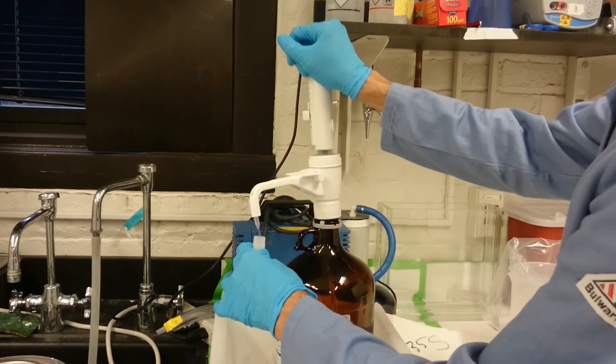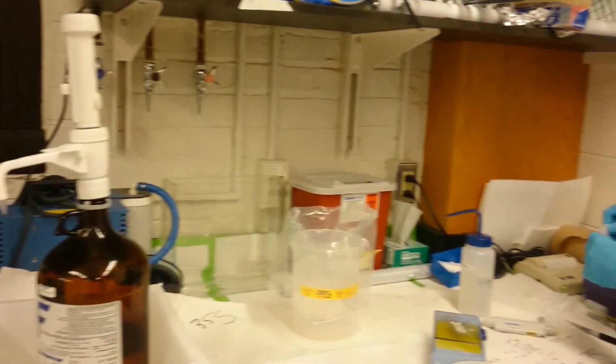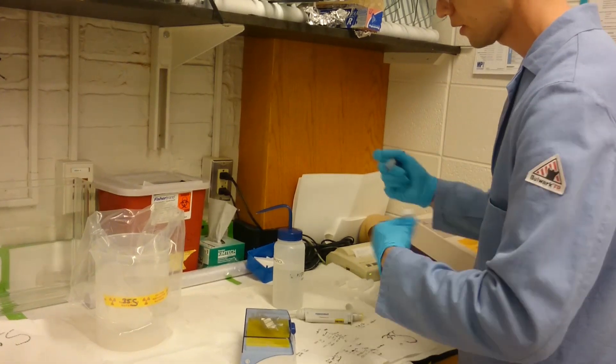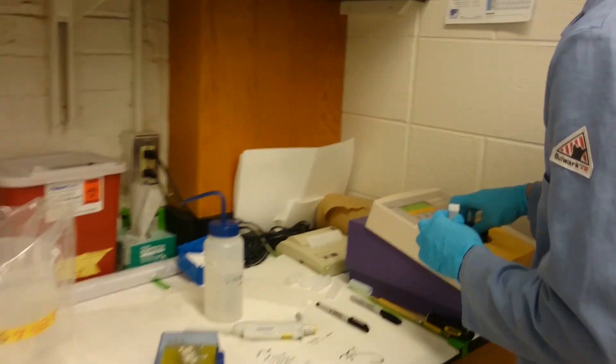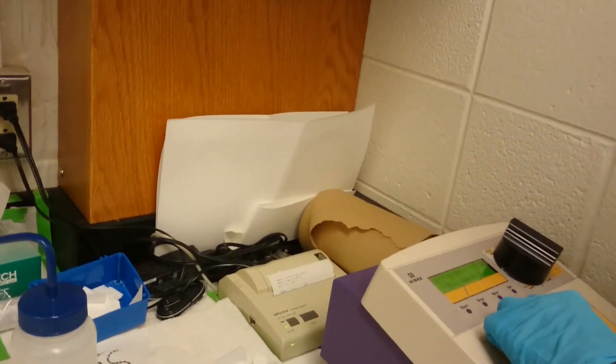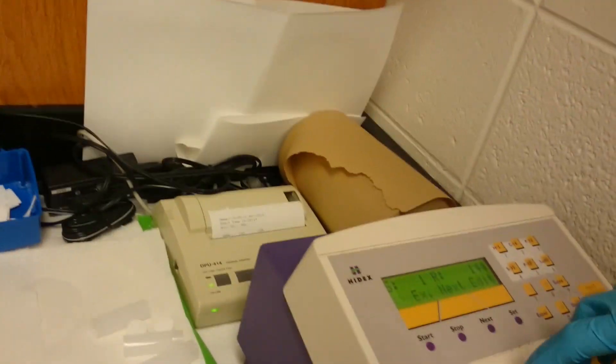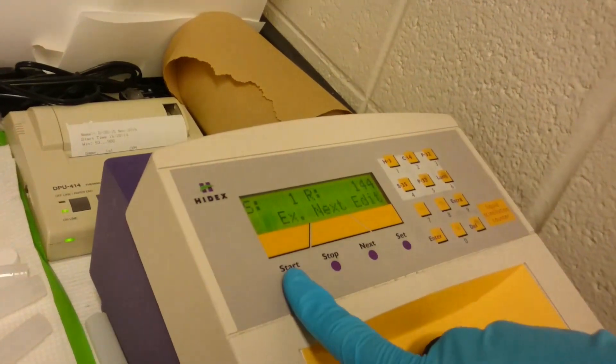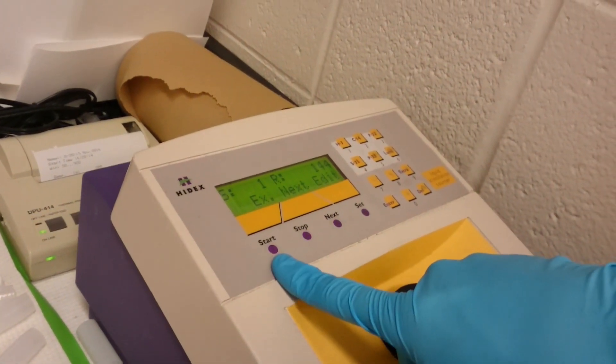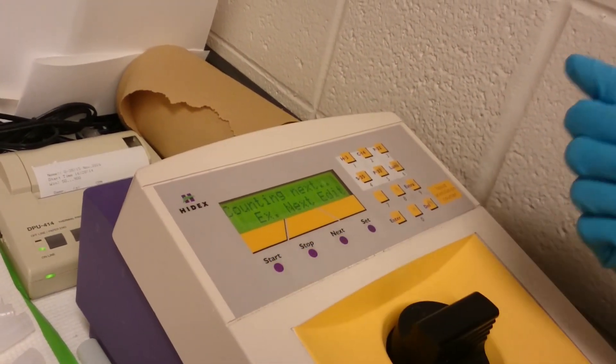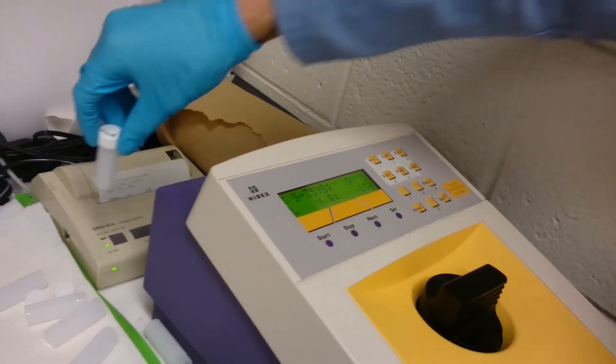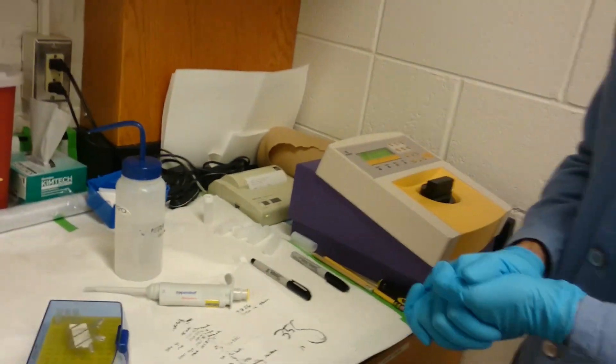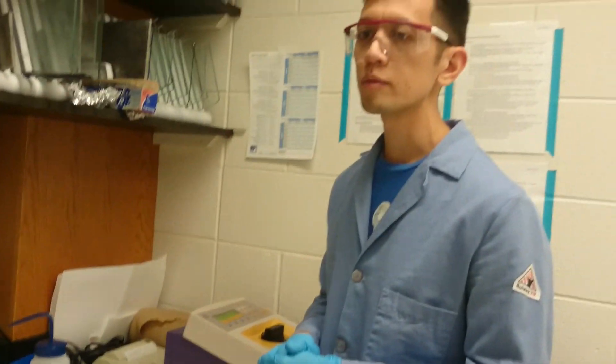Paper into the tube, fill the tube, label it. Push down and turn to lock and then you can either push start or you can push next. We're looking for things that are three times above background.